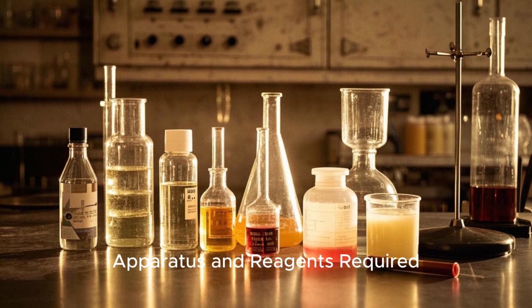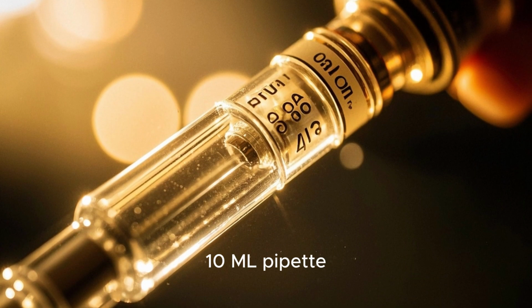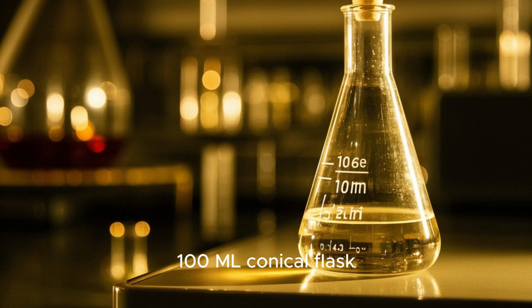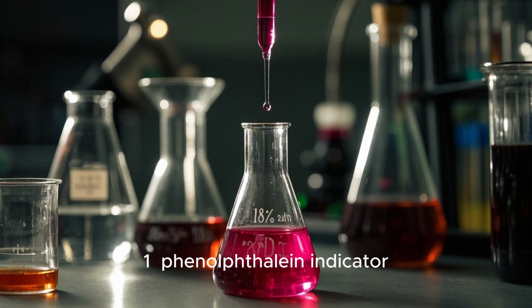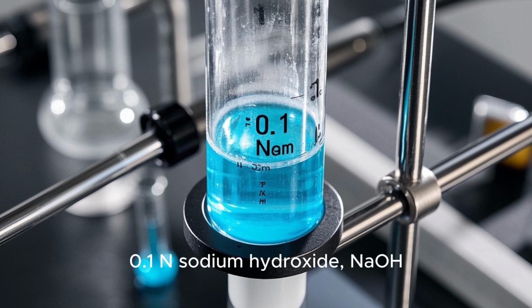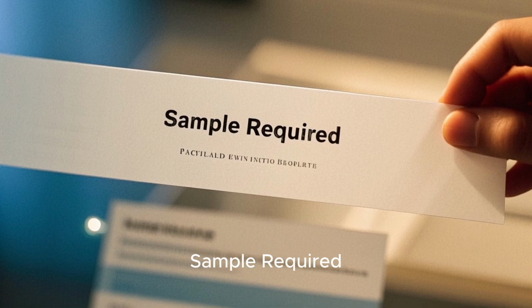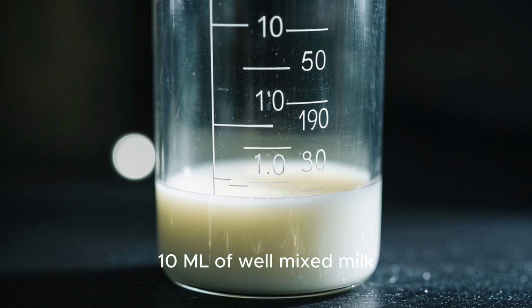Apparatus and reagents required: 10 ml pipette, 50 ml burette, 100 ml conical flask, measuring cylinder, 1% phenolphthalein indicator, 0.1 N sodium hydroxide. Sample required: 10 ml of well-mixed milk.